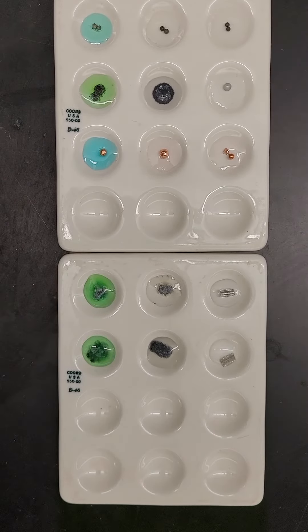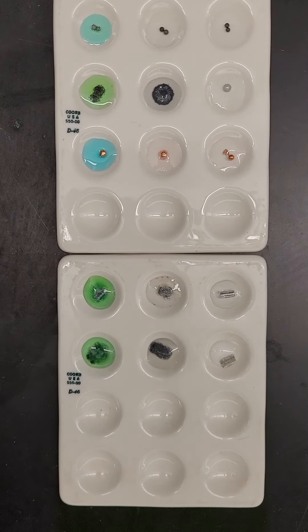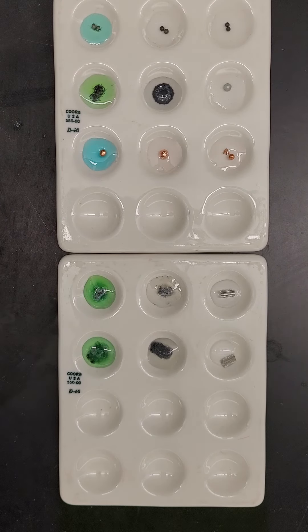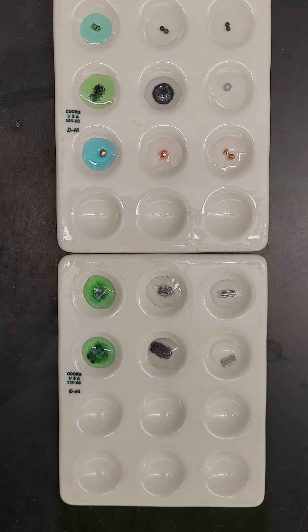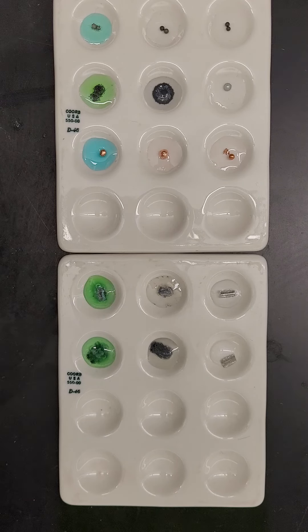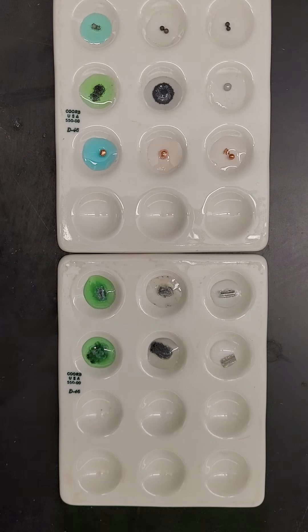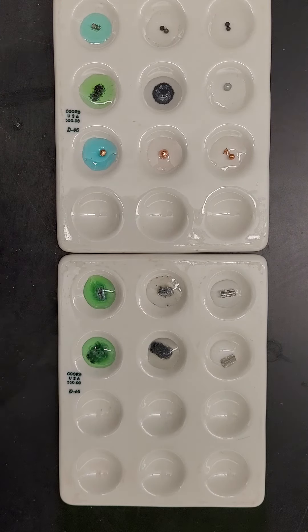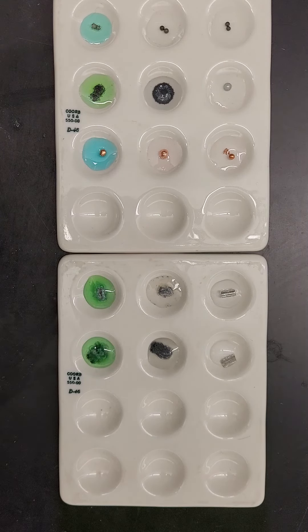This is part two of the single replacement reaction lab. The first column has lead in it. The first row barely has any noticeable change, and the second row with lead nitrate also has no distinguishable change. The third one with copper nitrate does look like there are some bubbles, and it also looks like the lead went through kind of a change in color.